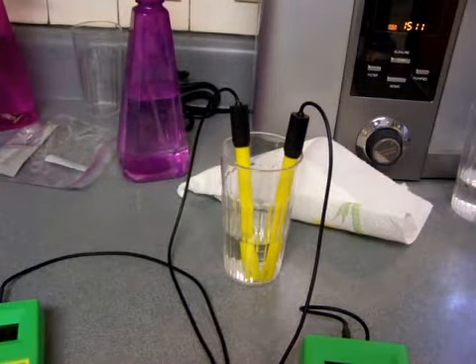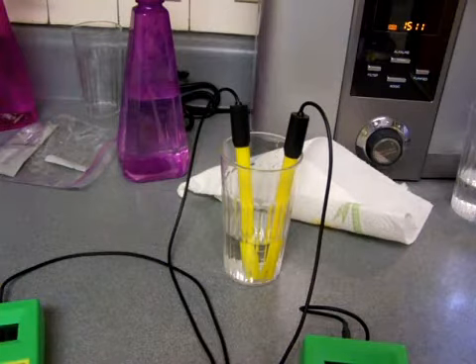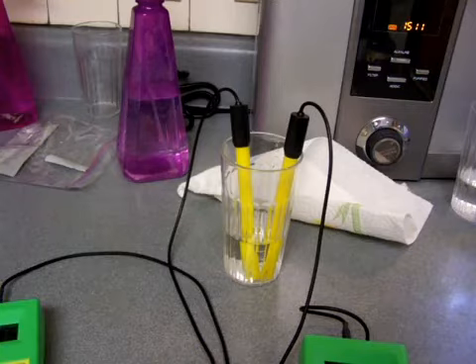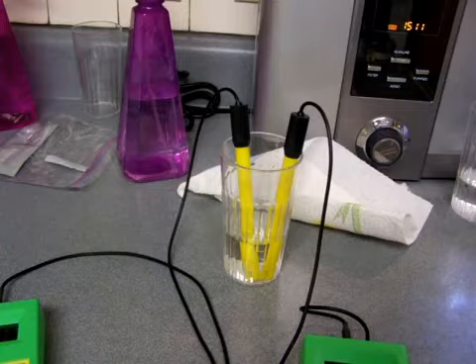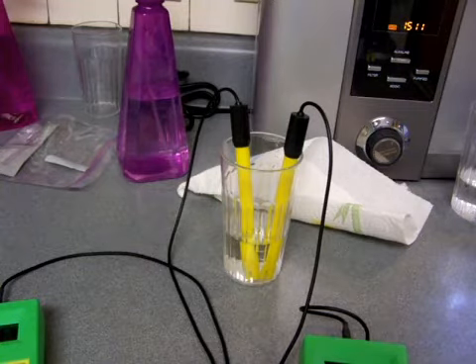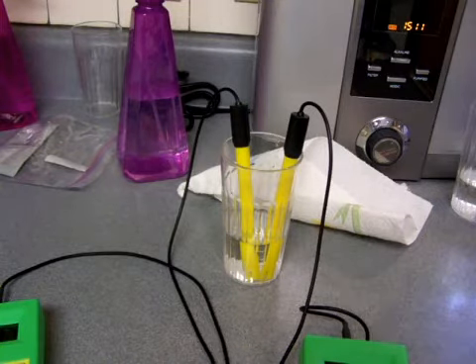Hopefully, most people don't need to really get an ORP meter. I only really did this demonstration for those people who are kind of like me. They want to test everything, and that's good to want to test everything, but you do have to know about the ORP meter and how wrong your results are if that meter is not clean.